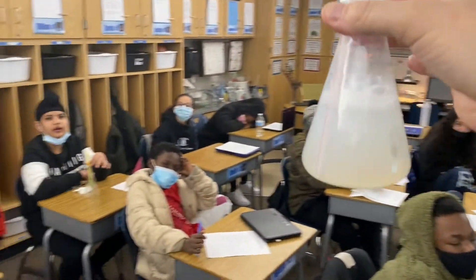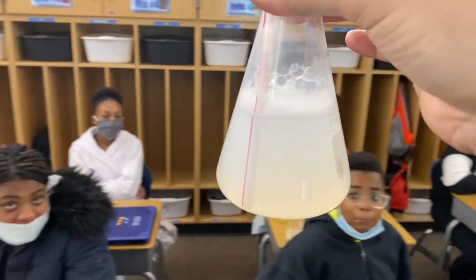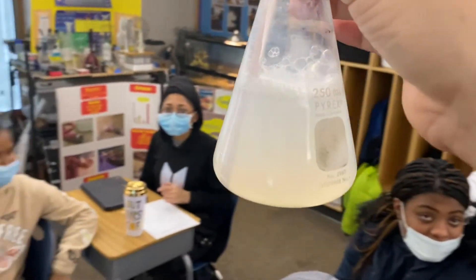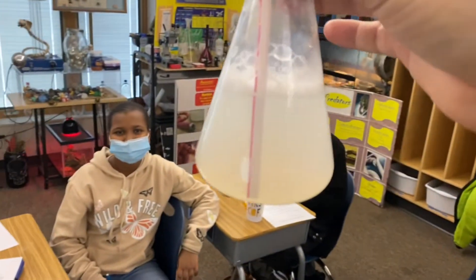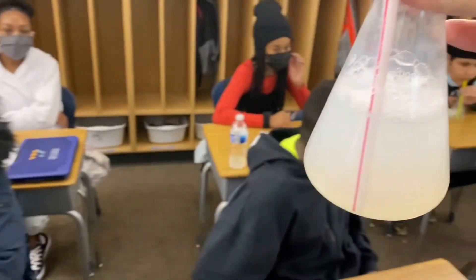This is where the calcium hydroxide that was saturated in the solution changes to calcium carbonate as you add CO2 from your lungs.